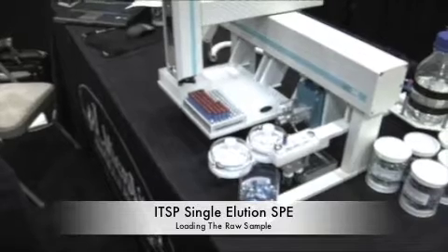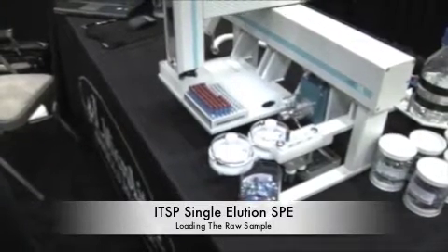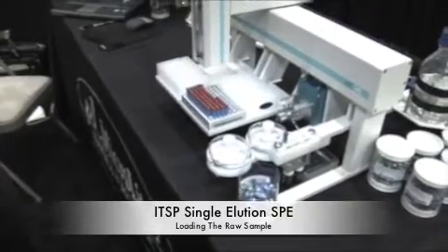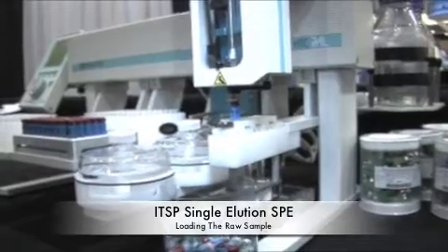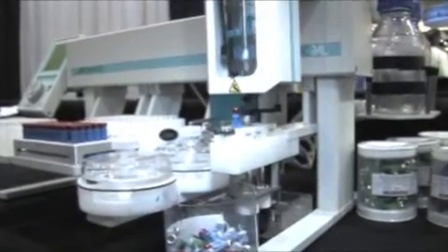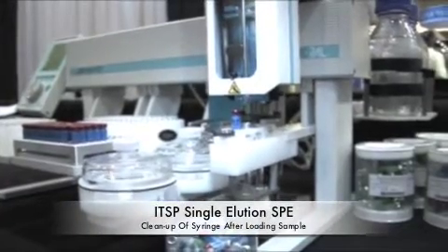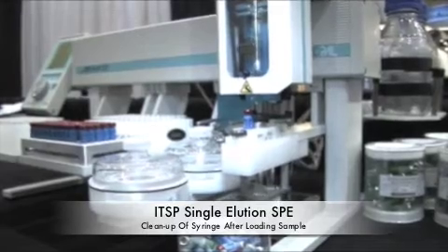You will load the sample over a waste receptacle. PAL has several locations that we can fix that to. We'll load the raw sample and then we will elute into the wells on the back plate. Sample volume's up to you, really. We have bed masses from 3 to 25 mgs. It's very versatile. You're scaling down. It's comparable to the 96 well plate extraction.